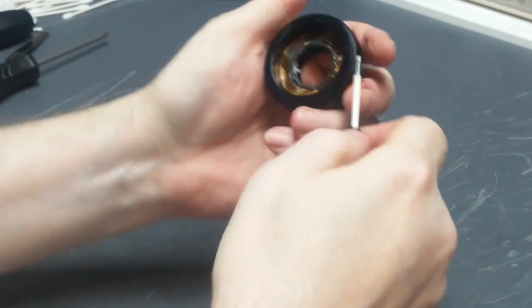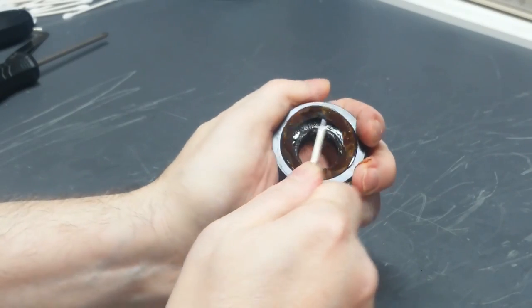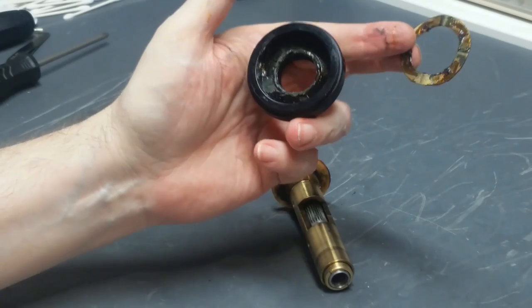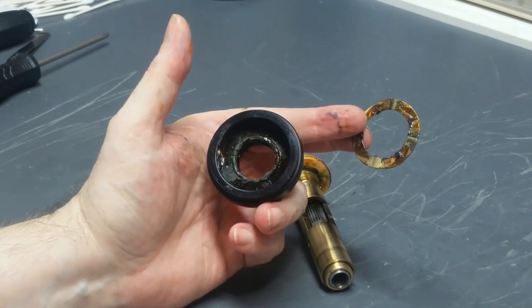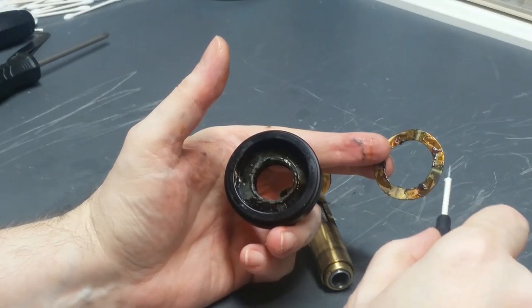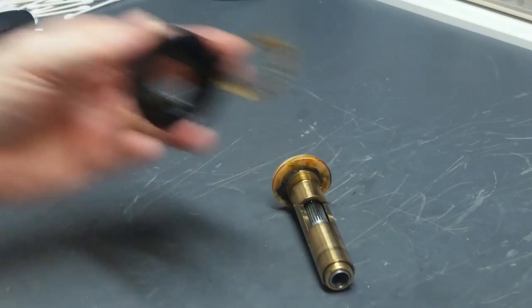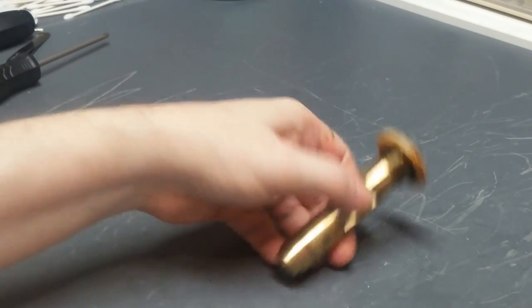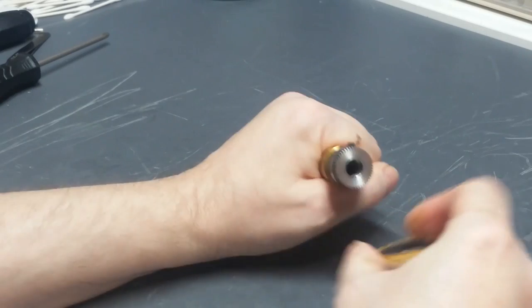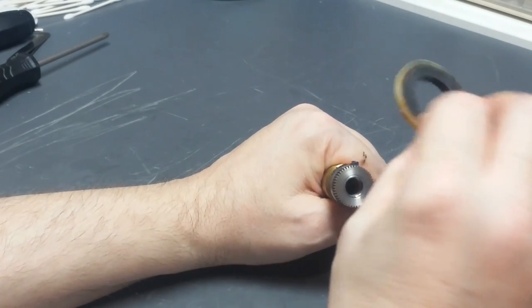Inside of here, there's a wave spring washer, which is disgusting. Inside of there, all this old grease. This is why these scopes can literally lock up on you. This used to be grease, now it's like polymerized waxy muck. So we'll thoroughly clean that, of course. Now what's left on this thing is a plastic washer, kind of a thrust washer thing. It's probably nylon, and it's equally disgusting.